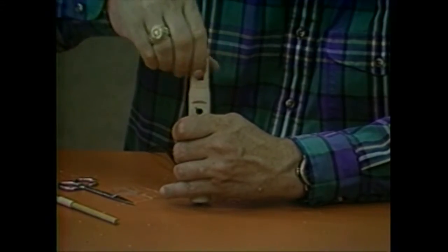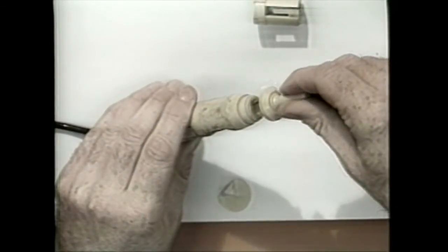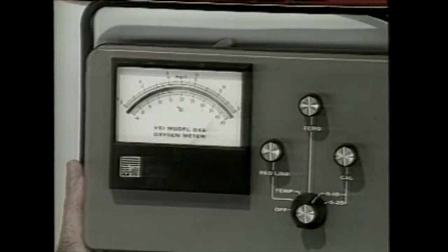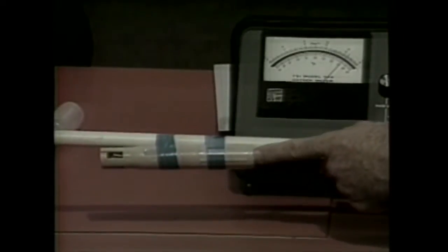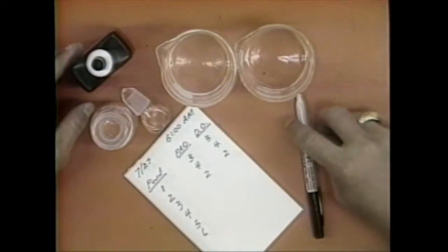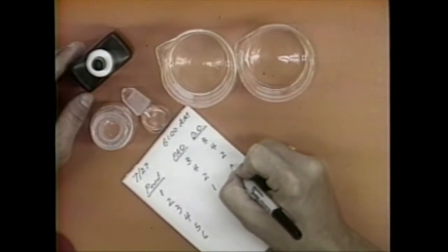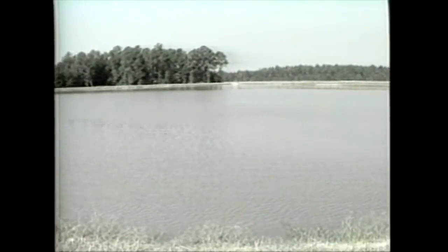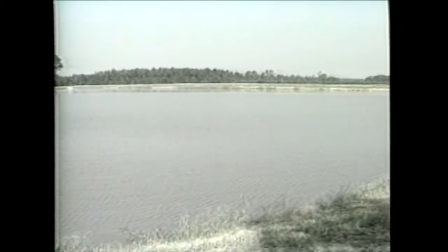Periodically the probe's metal electrodes have to be reconditioned. Reconditioning kits are available from the manufacturer and the procedure is rather simple. One problem that commonly occurs is needle jumping, which is usually a result of a short in the cable. To help prevent this, tape the probe and cable to a pole. During the summer, dissolved oxygen should be recorded twice daily, ideally at dawn and dusk. Records should be kept which may indicate trends that may affect fish if corrective measures are not taken. During the cooler months, where there is less danger of oxygen-related fish kills, measurements may be reduced or discontinued, depending on the stocking density of the pond. A simple model may be constructed from oxygen measurements taken during the evening and night, which when used properly can accurately predict the oxygen concentration of the pond at its lowest level. Since this low usually occurs near dawn, it may also save the producer some sleep.